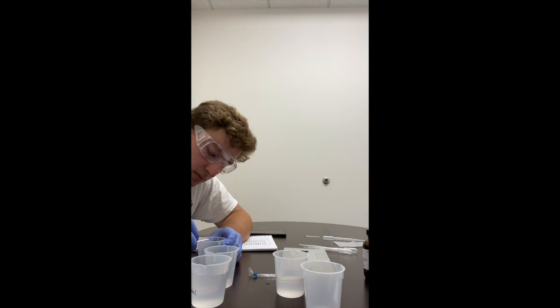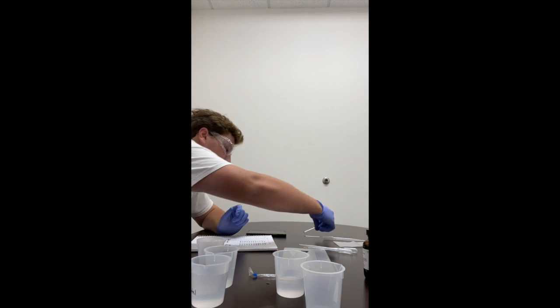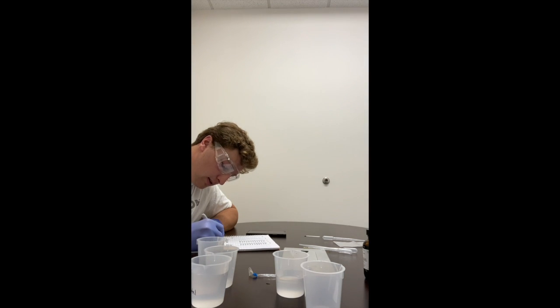So it's turning a little dark. It's like a little dark green color. With IKI, it is dark green.